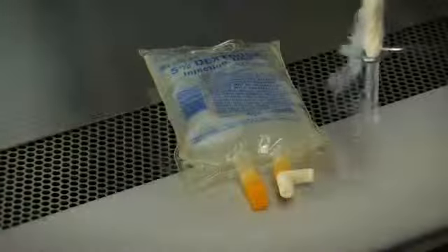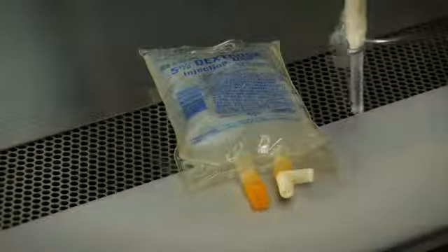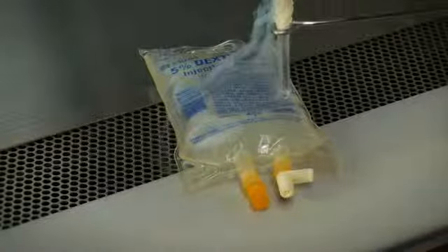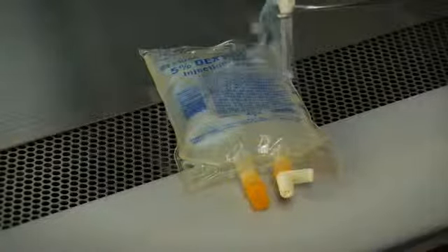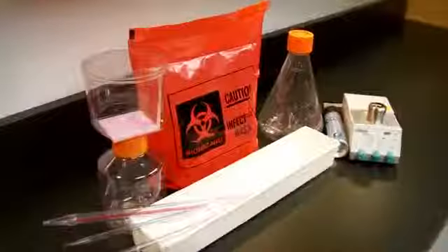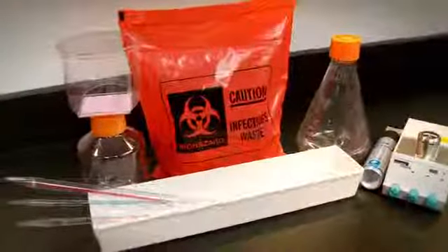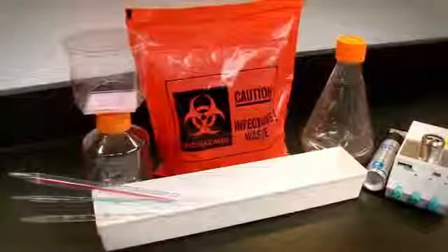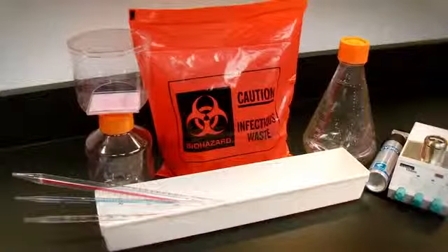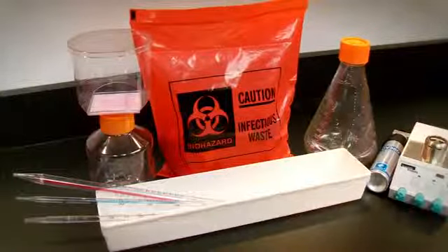Materials or equipment placed inside the cabinet may cause disruption to the airflow, resulting in turbulence, possible cross-contamination, and or breach of containment. Bulky items such as biohazard bags, discarded pipette trays, and suction collection flasks should be placed to one side of the interior of the cabinet.